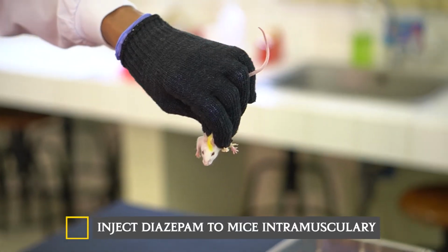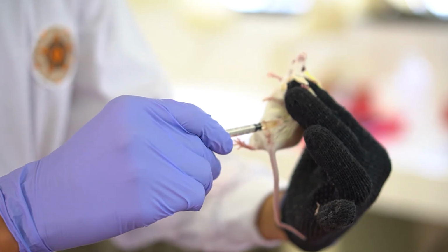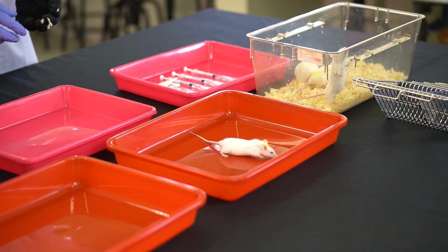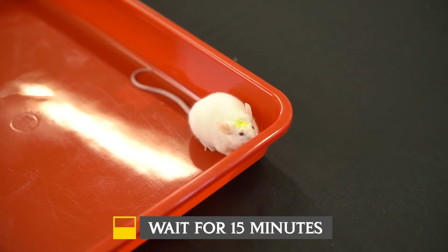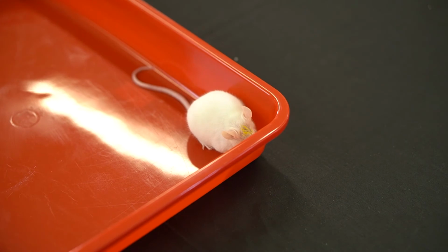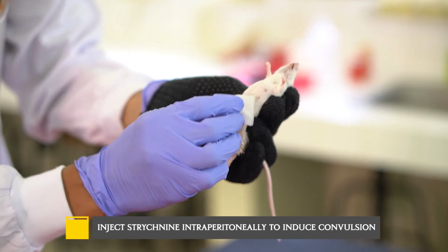Inject diazepam to mice intramuscularly. Wait for 15 minutes. After 15 minutes, inject the strychnine intraperitoneally to induce convulsion.